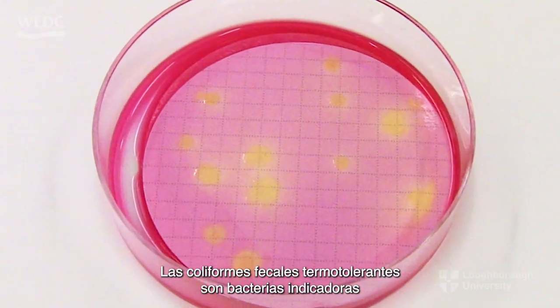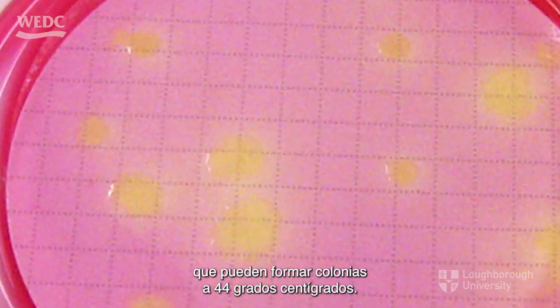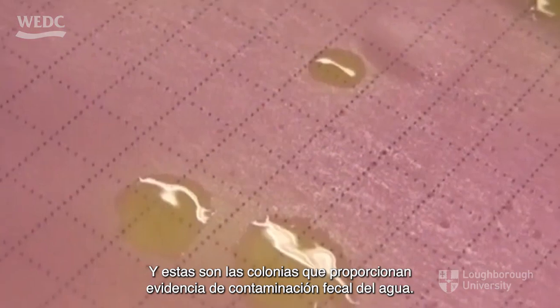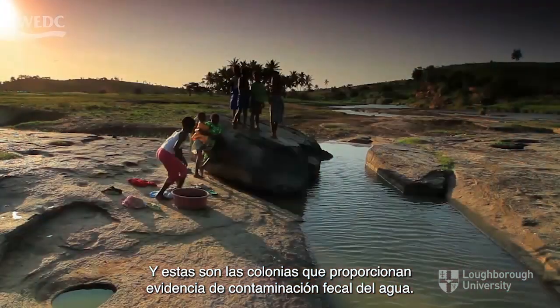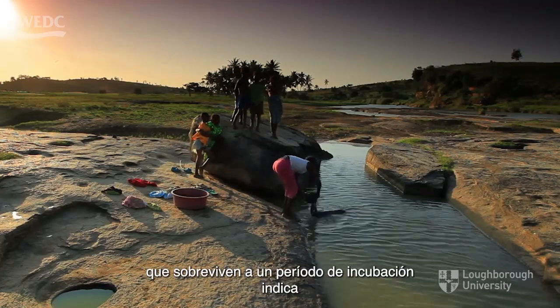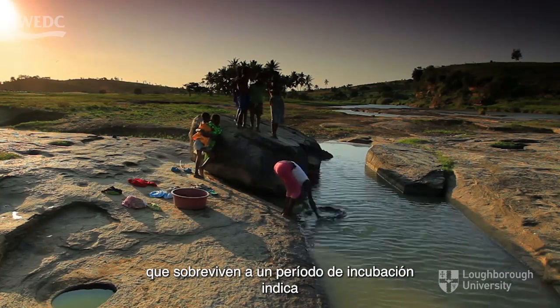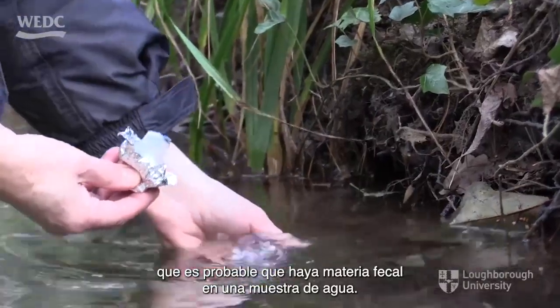Thermotolerant fecal coliforms are indicator bacteria which can form colonies at 44 degrees centigrade, and these are the colonies that provide evidence of fecal contamination of water. The analysis of colonies of fecal indicator bacteria that survive an incubation period indicates that fecal matter is likely to be present in a water sample.